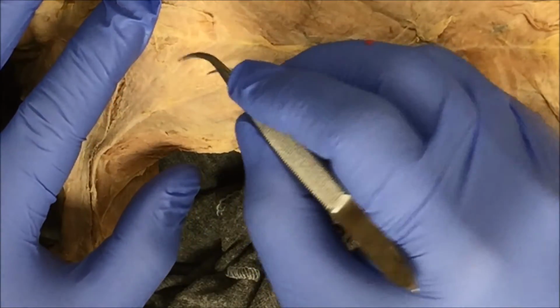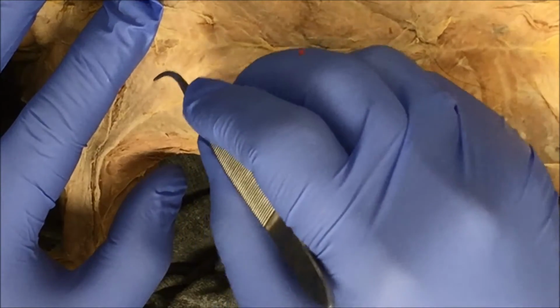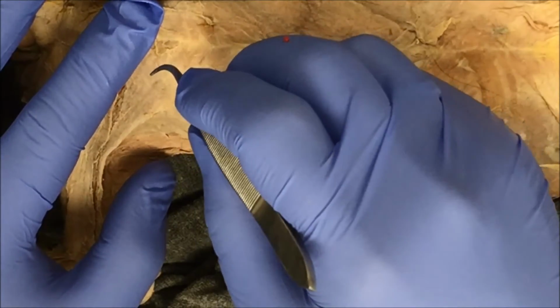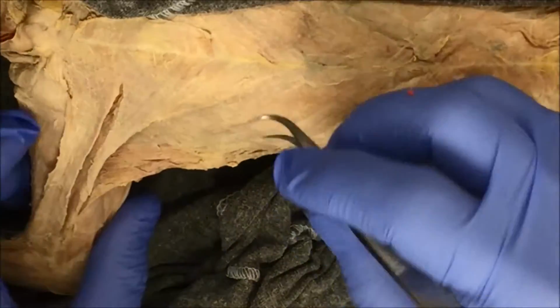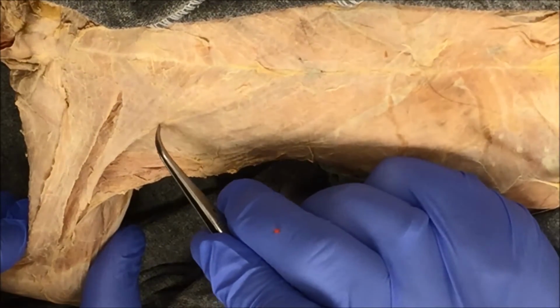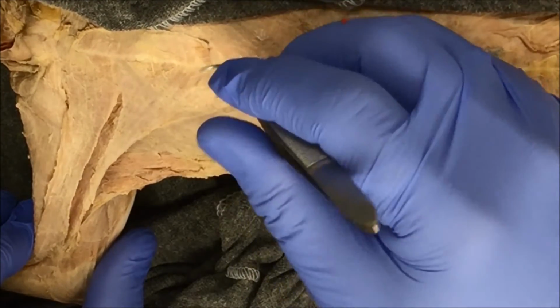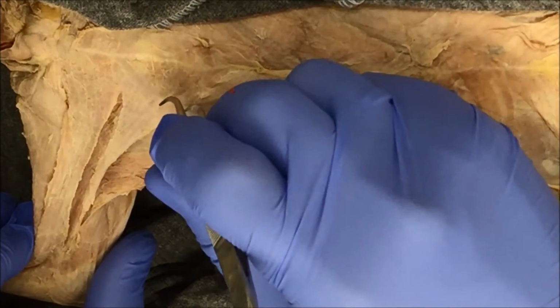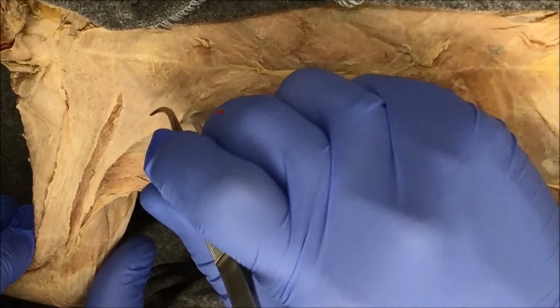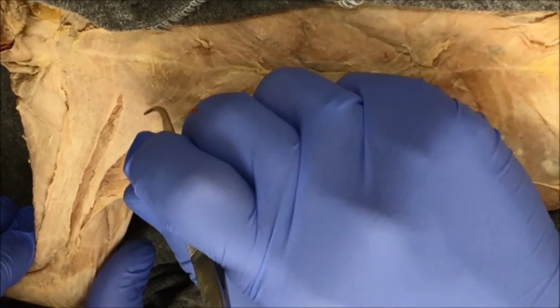And this is where it gets a little challenging as you get closer to the chest. The muscles really start to adhere to one another. So like I said, I'll attempt. I may not be successful, but I will. There's a line right here, and I'll see how far I can do the pec major. Chances are I'll probably stop. I probably won't go any further, but I'll attempt, just to kind of see.